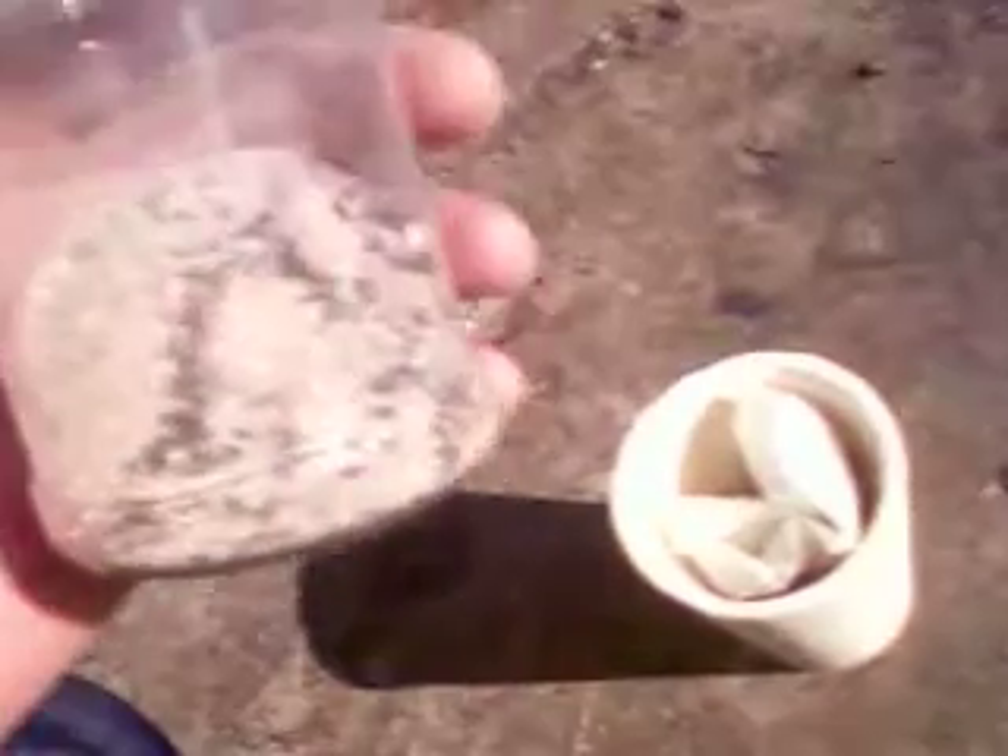I am actually going to light the filter inside the crucible and burn it down to an ash. And after it is burned down to the ash, then I will take my flux here — assay flux. This is a standard assay mix, it is what I use on ore. And I am going to run it with this flux and it will produce a lead bead — a lead prill as it is called.